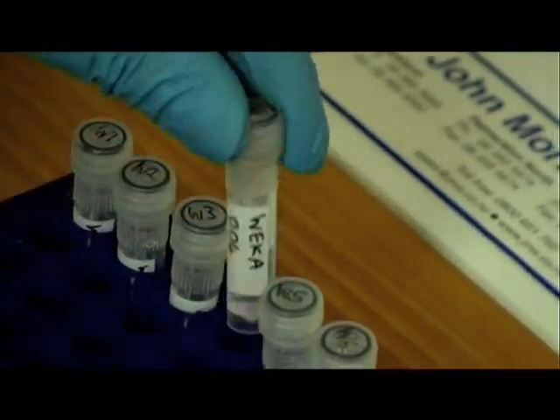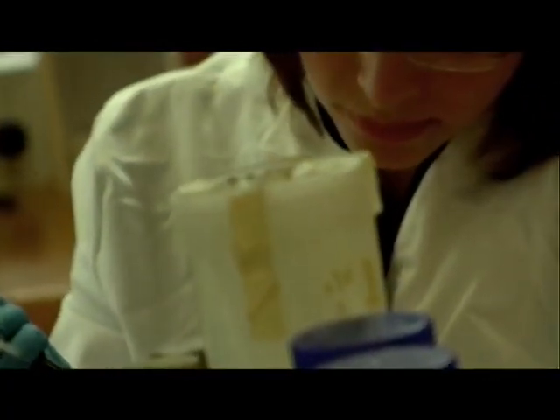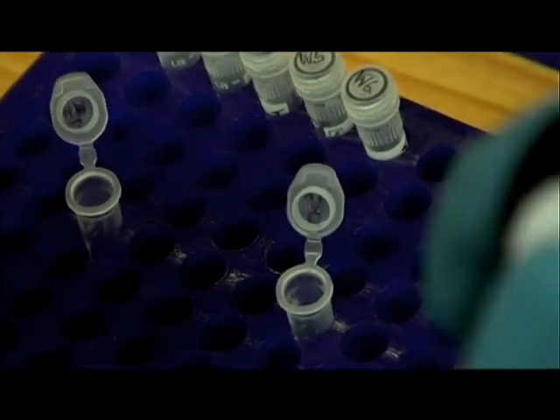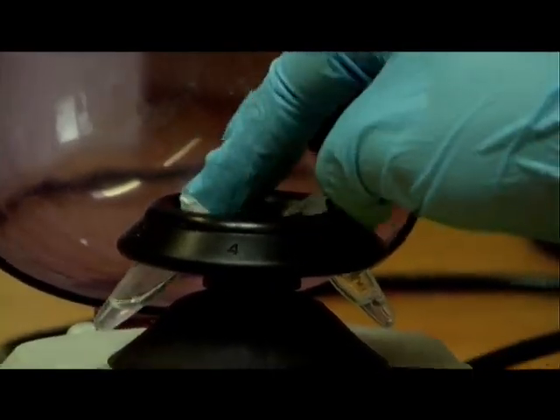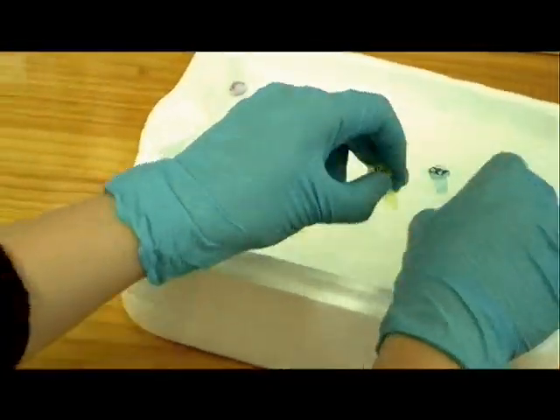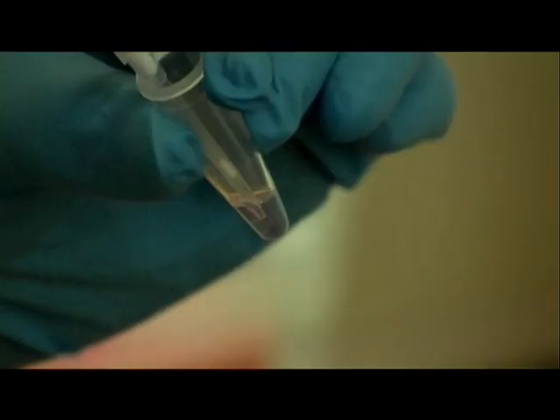We will use our weka genomic DNA as a template for two PCRs: the first to determine how genetically different the weka are from each other, and the second to find out what sex they are. The only difference between these two PCRs is the primers that are used. Our PCR needs a number of different components: buffer so the conditions are optimal for Taq enzyme activity; a mix containing all four free nucleotides A, T, C, and G; and water to make it to the right concentration. Primers are short sequences, or oligonucleotides, that are complementary to the target DNA fragment. We need a forward and a reverse primer for both PCRs. The primers sit at each end of the region we wish to amplify. Finally, we add the enzyme Taq polymerase, and the master mix is distributed into all of the PCR tubes.